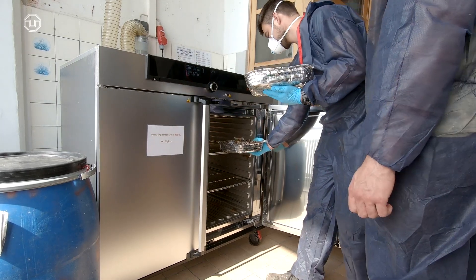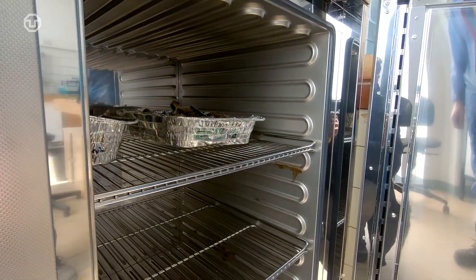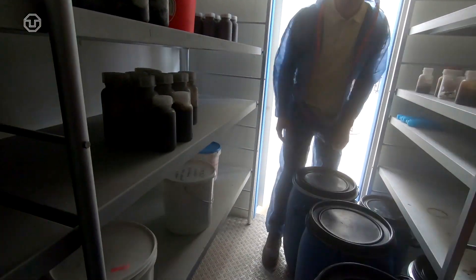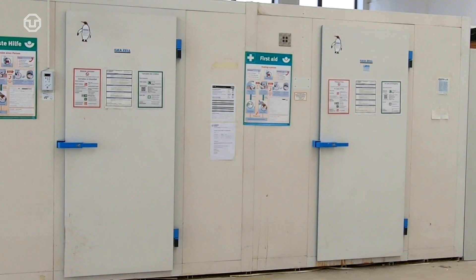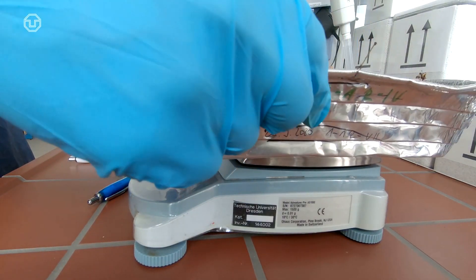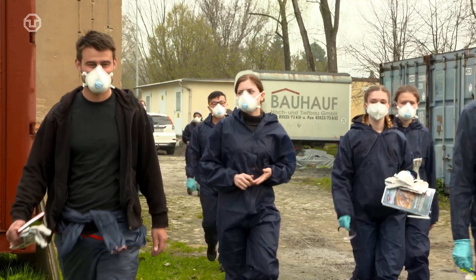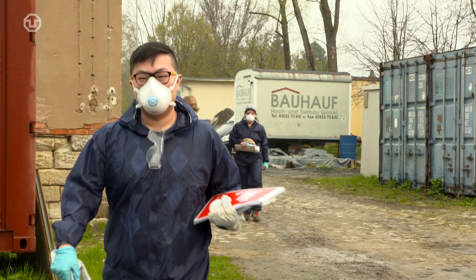A part of the taken samples is placed in the drying cabinet to determine the water content. The other part is placed in the freezer together with the reserve sample. The low temperatures stop microbiological activity and thus decomposition, so the material properties remain stable. The laboratory analysis of the waste will take place at a later date. After all practical work has been completed, work surfaces and equipment are cleaned and placed back in their designated locations.